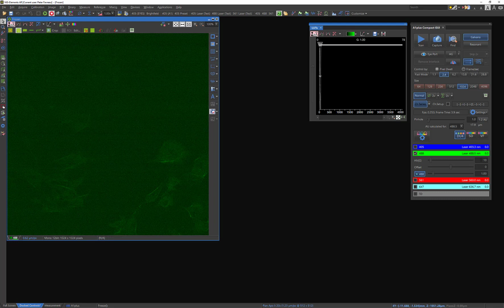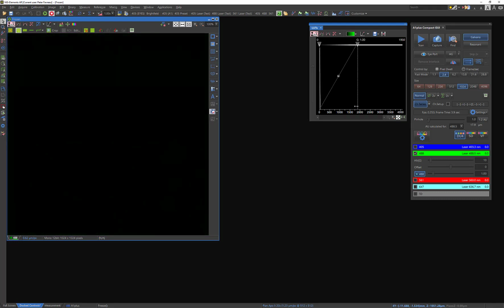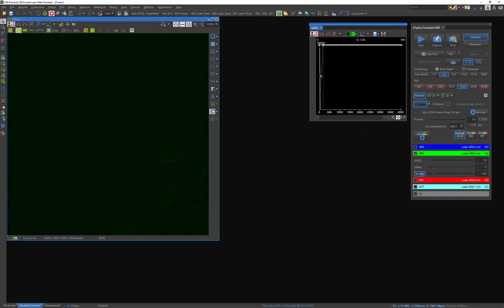And that's of course because we started with some very modest settings on my gain and my laser power. So now let's go ahead and start adjusting these so that I can get a much better signal to noise ratio, as they call it, or big contrast between my signal and my background. And to do that, I'm just going to start by increasing them both until I get to a better value here. So gain gives me a pretty big jump here. I'm just going to adjust these so they're some newer values, and let's hit play again and see where we're at.